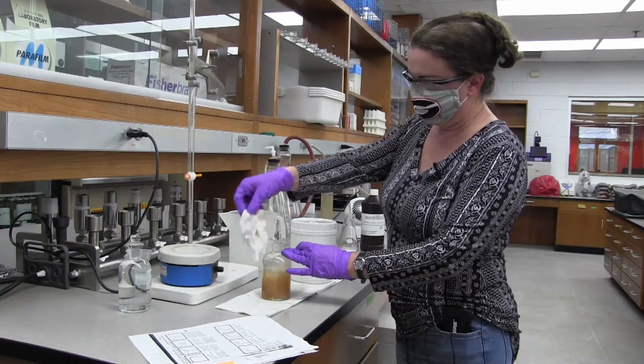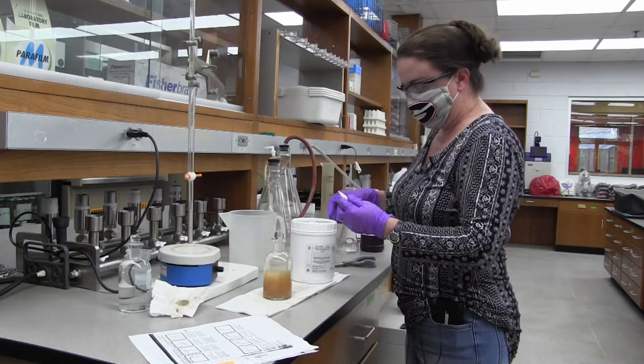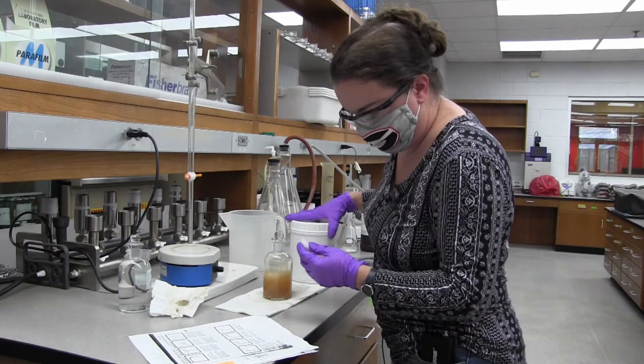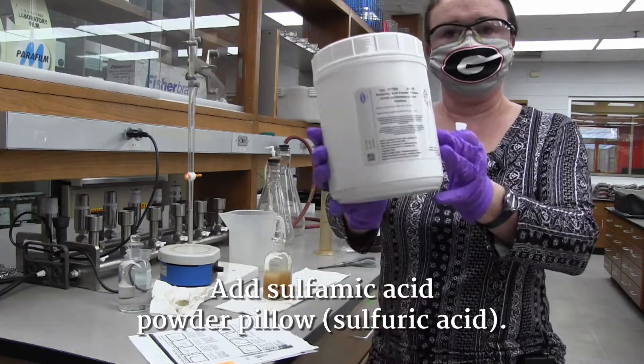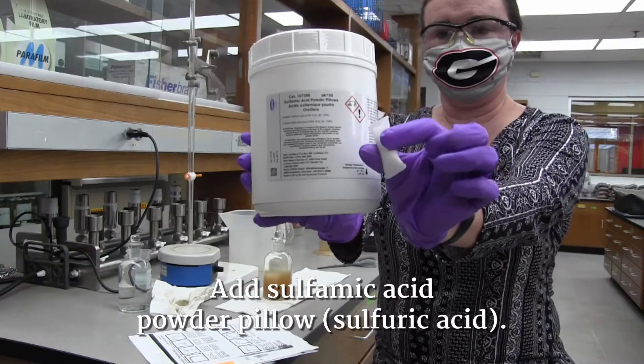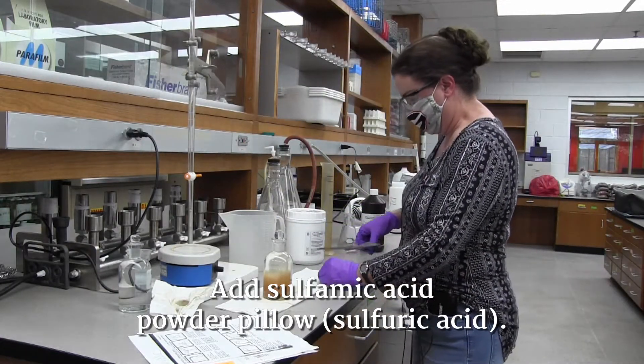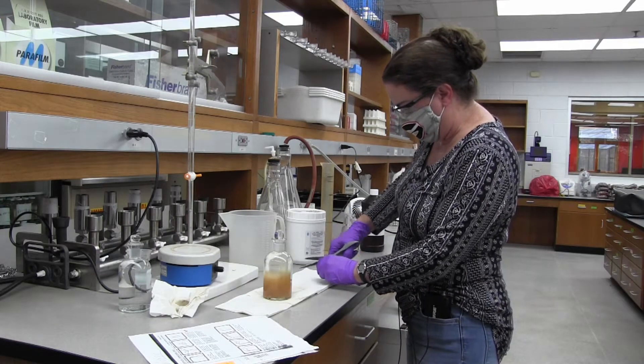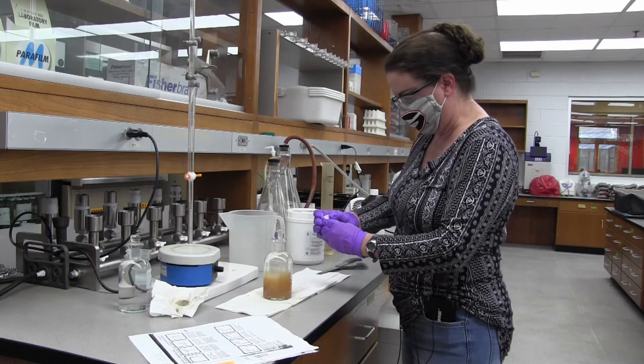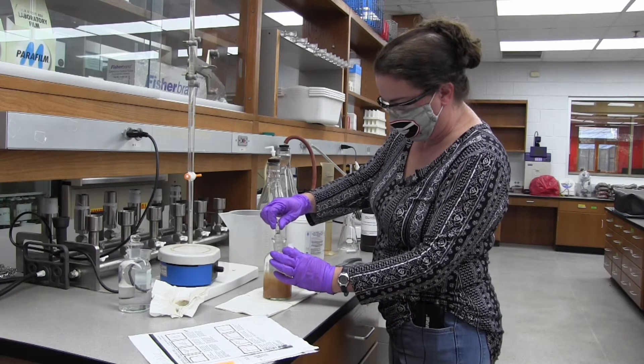Now I'm going to take the paper towel off of the stopper. Now we're going to add the contents of a sulfamic acid powder pillow. All this flock should clear up now. It'll still be an amber color though.